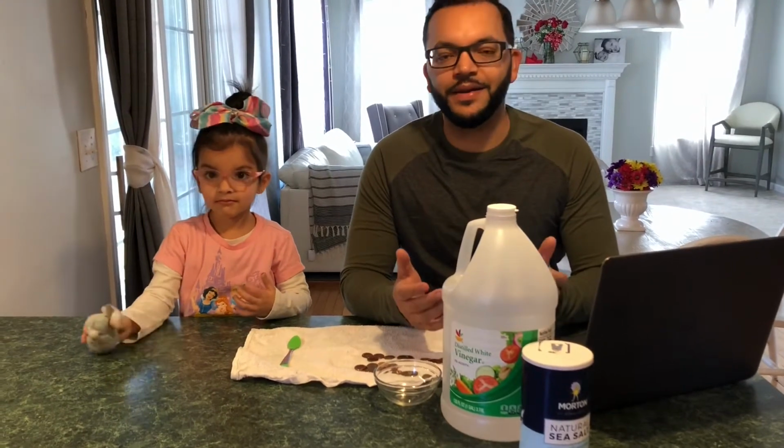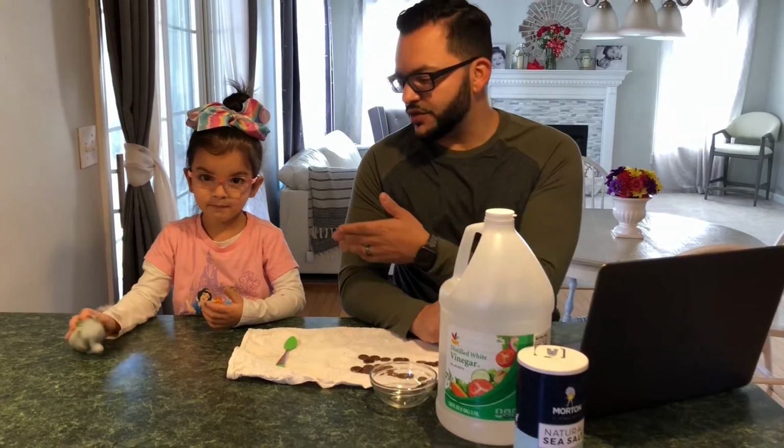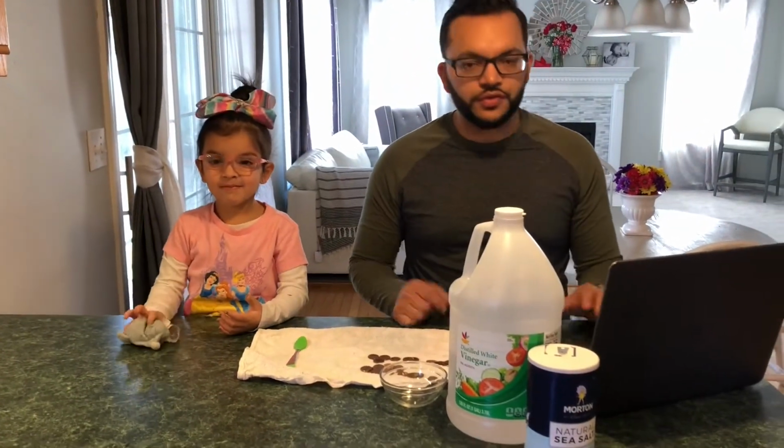Today we're going to be doing penny oxidation. So I have everything I need here, and I have my trusty assistant Leia, who's going to help me out. So just real quick overview.